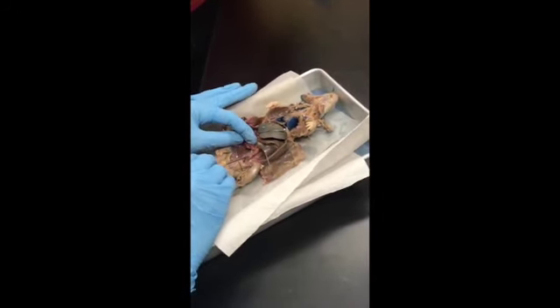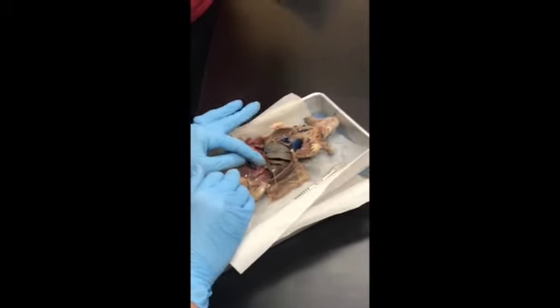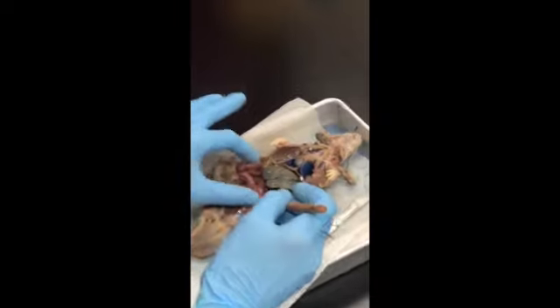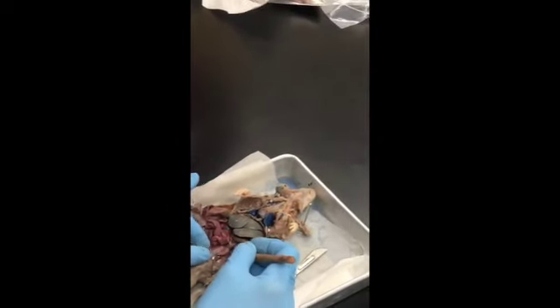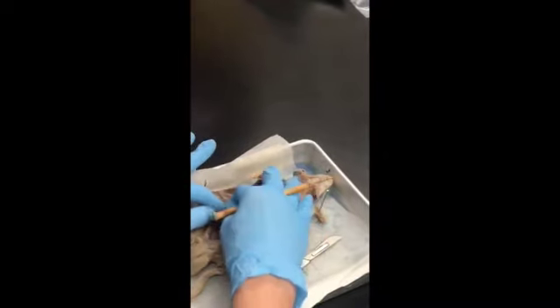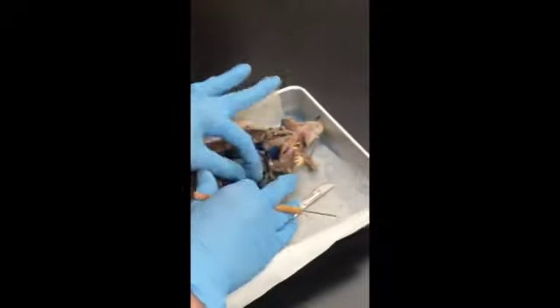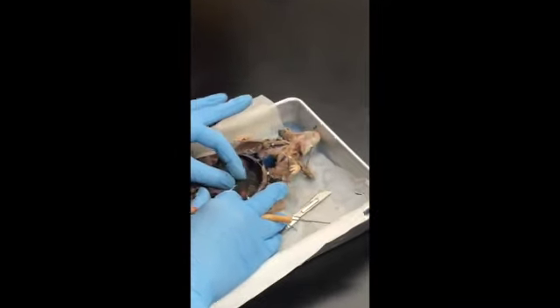And then we have the rectum, which is down here, this long part. It's on the side. So the rectum would be like this part right here. So I moved all the intestines out of the way. Okay. So here's the rectum right here. So descending, ending in the rectum. And then if you look way up underneath the liver, we have a kidney. And then we have another kidney on the other side.